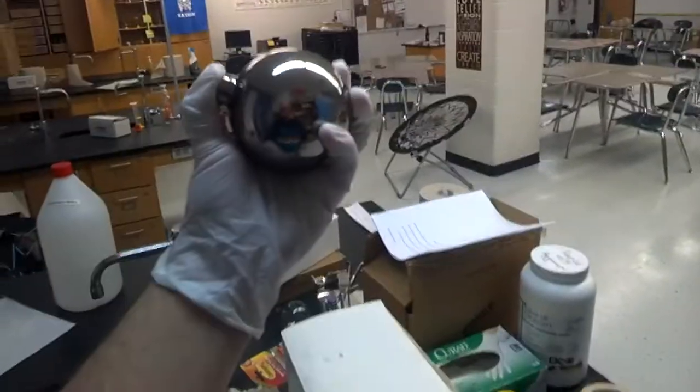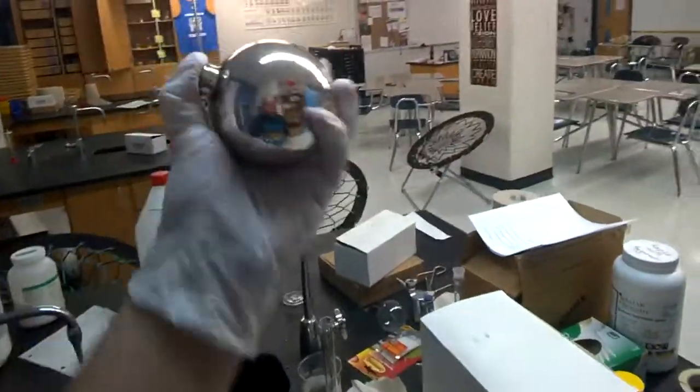You want to keep going. I've got a really good reaction right now. You can see it's nice and silvery. And as the reaction continues, you'll see that all of a sudden it goes from dark to beautifully silver.